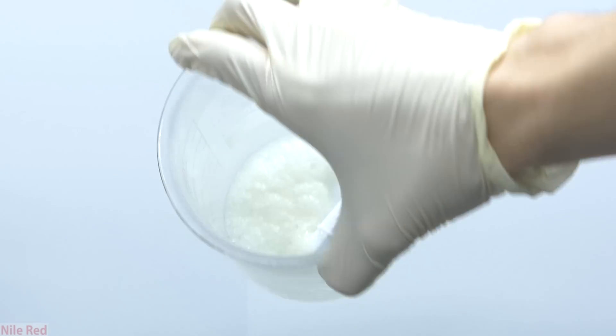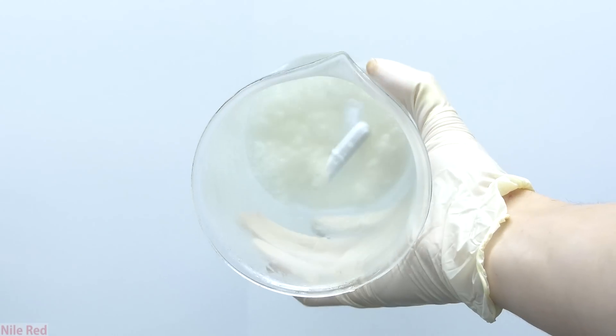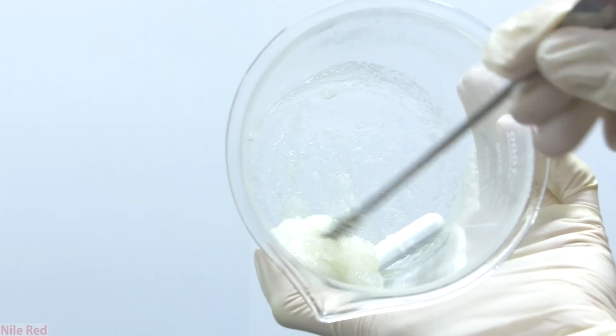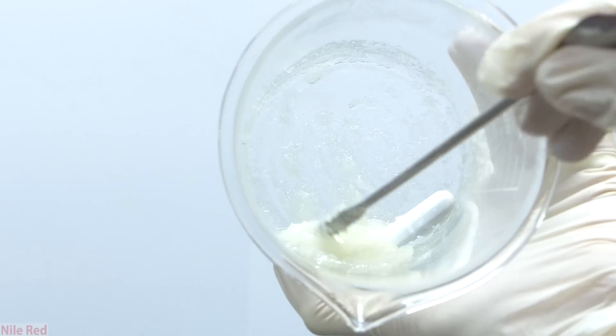The oxalic acid was placed in a freezer to fully precipitate everything, and you can see at this point that it's no longer yellow. The next step is to filter off the oxalic acid, and when I go to remove it from the beaker, you can see it's kind of a gooey mess.